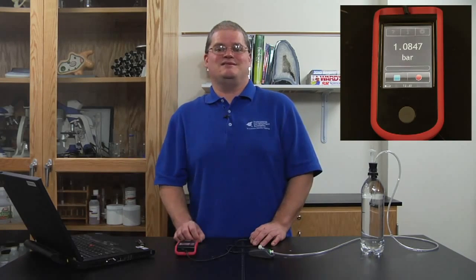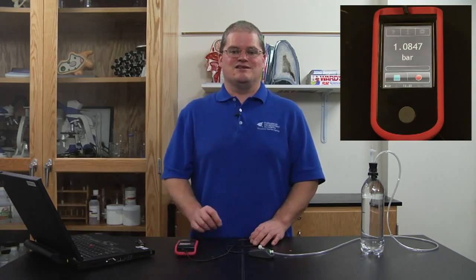Today, the experiment I'll be demonstrating is an experiment where I will attempt to determine the pressure necessary to make a Cartesian diver neutrally buoyant. Once I collect the data, I'll import the data into Excel so that it can be easily seen and analyzed.